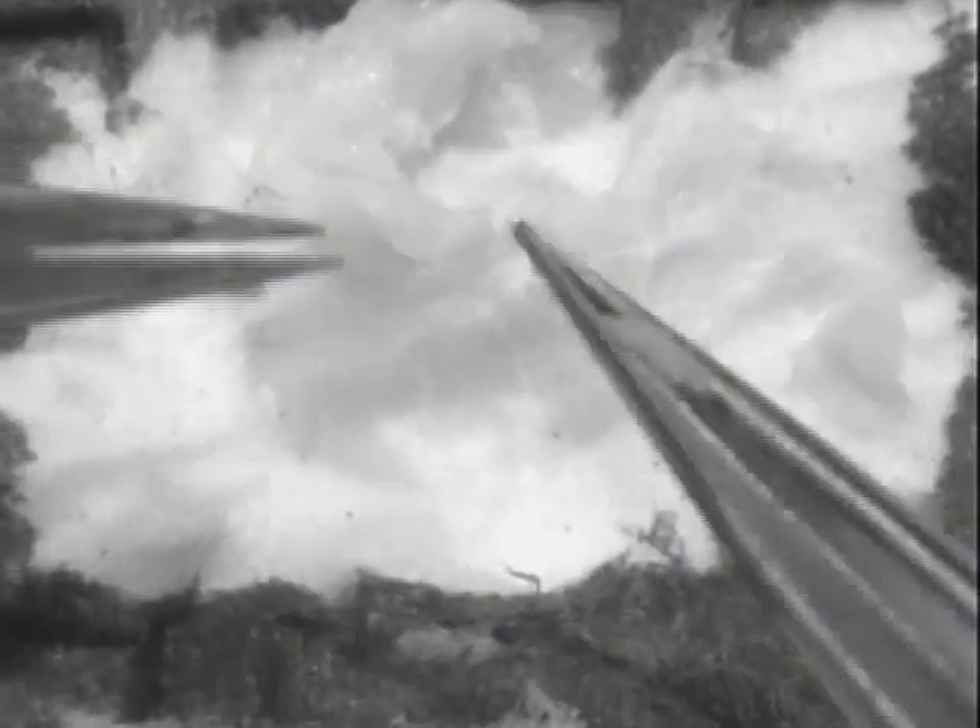I'm dissecting on a sterile paper towel and I used marker to outline the area visible to the camera, which is actually much smaller than the microscope field, to keep my dissection within view. I'm cutting off the rest of that cortex that stayed attached to the hippocampus. Now I have a fairly clean hippocampus, which we can use to extract RNA from.